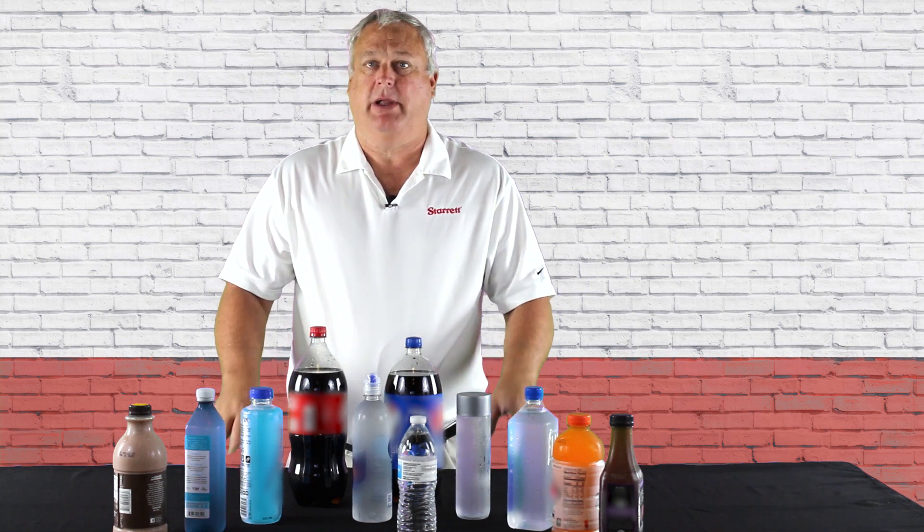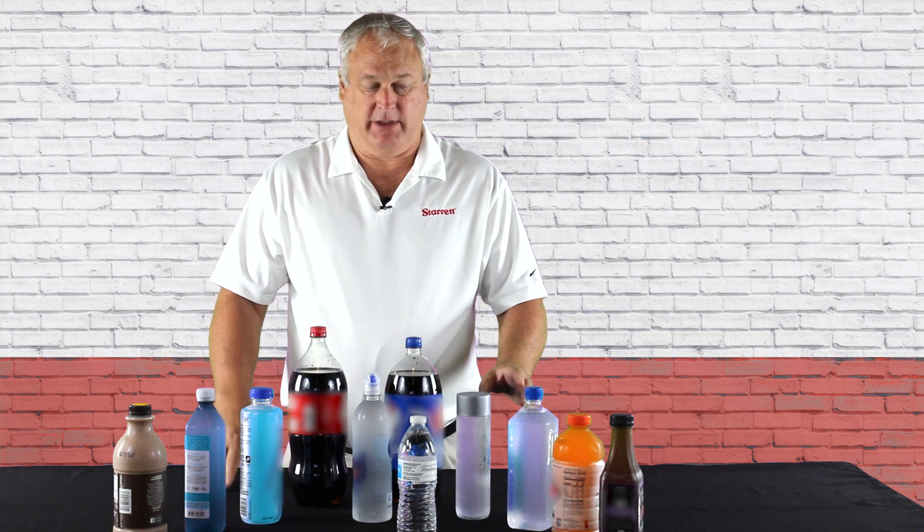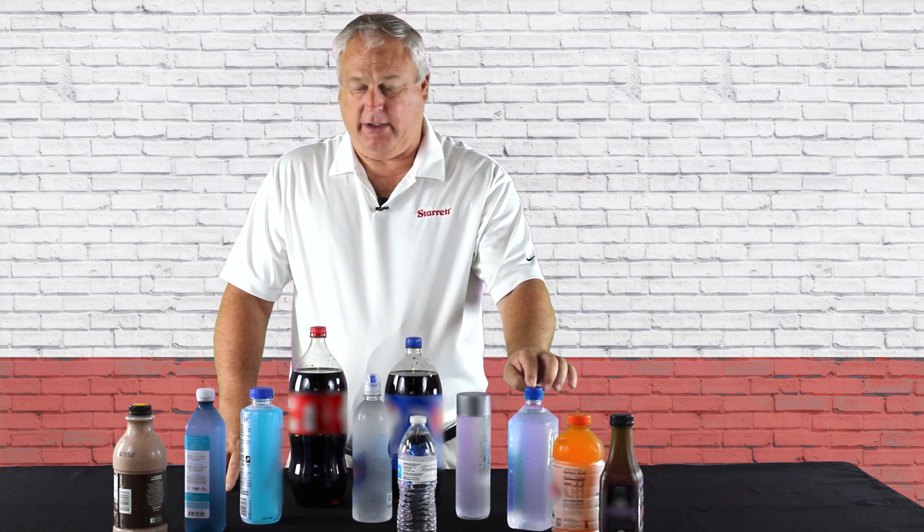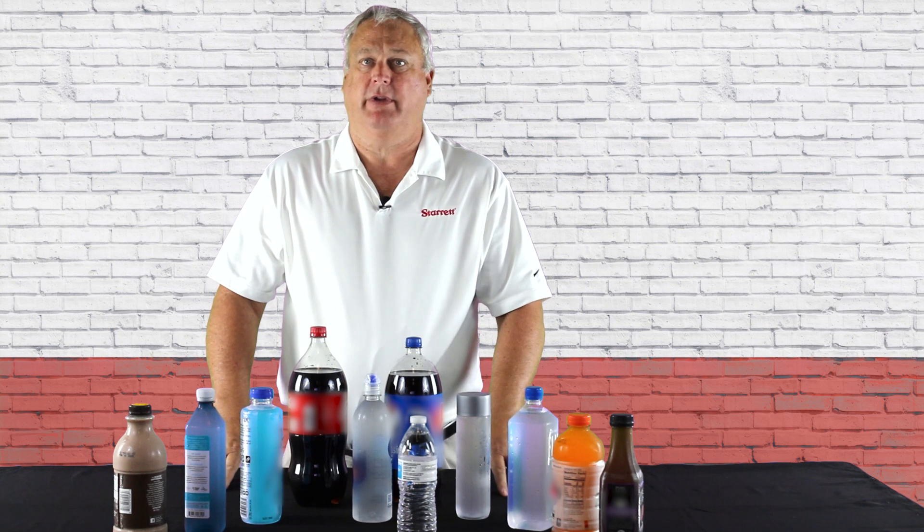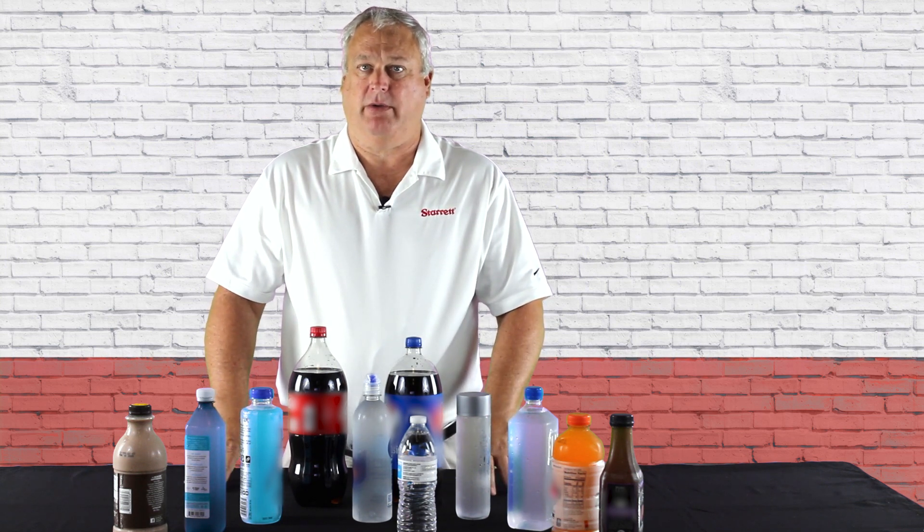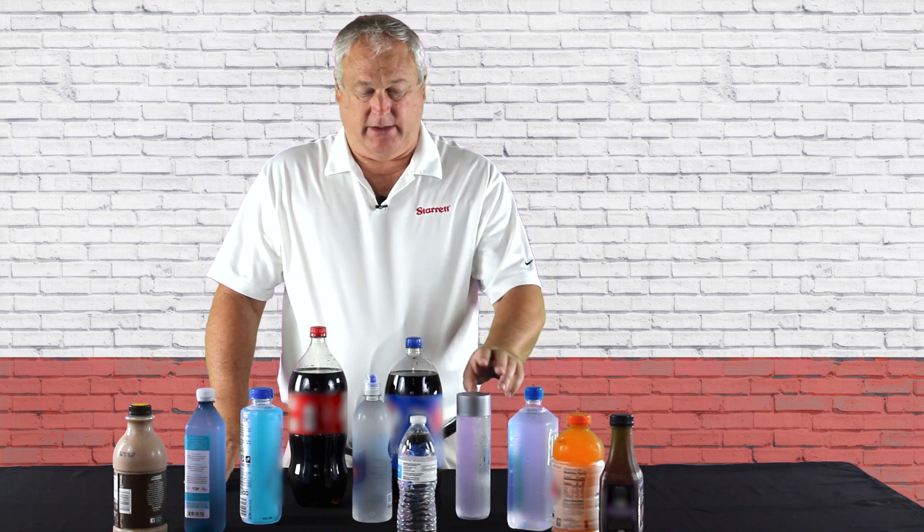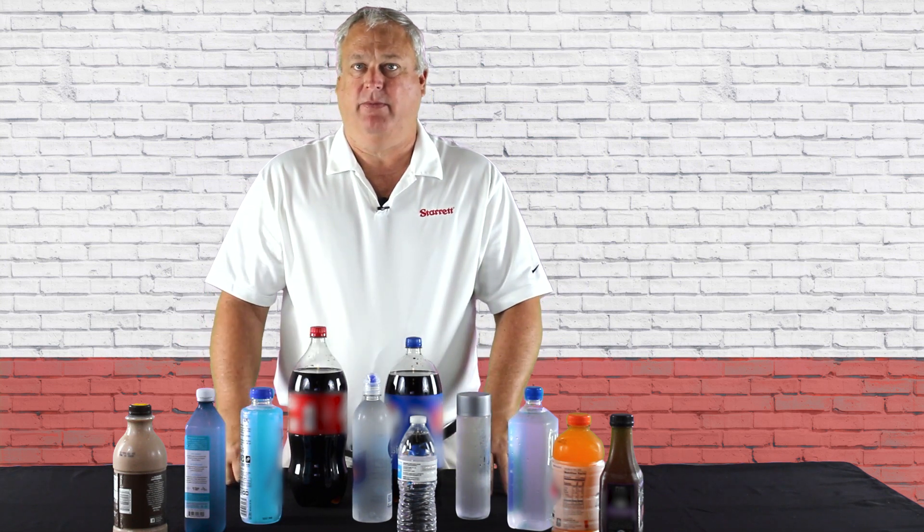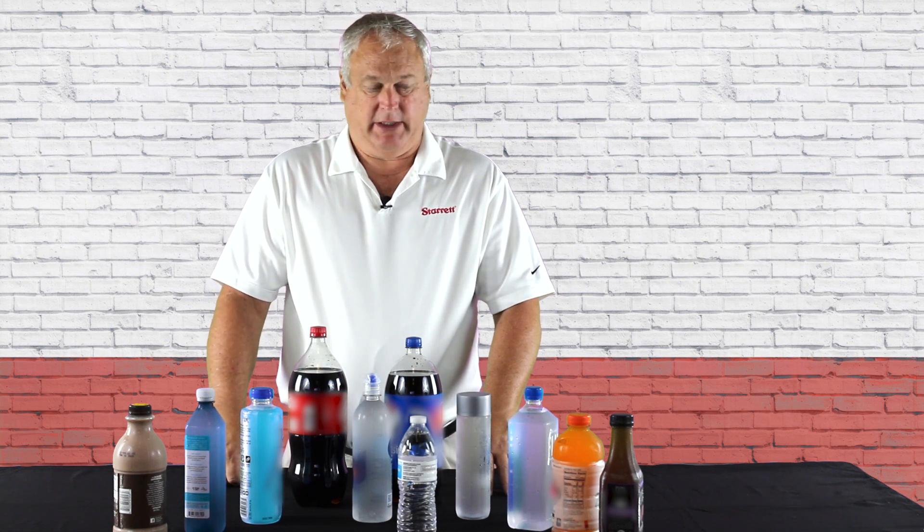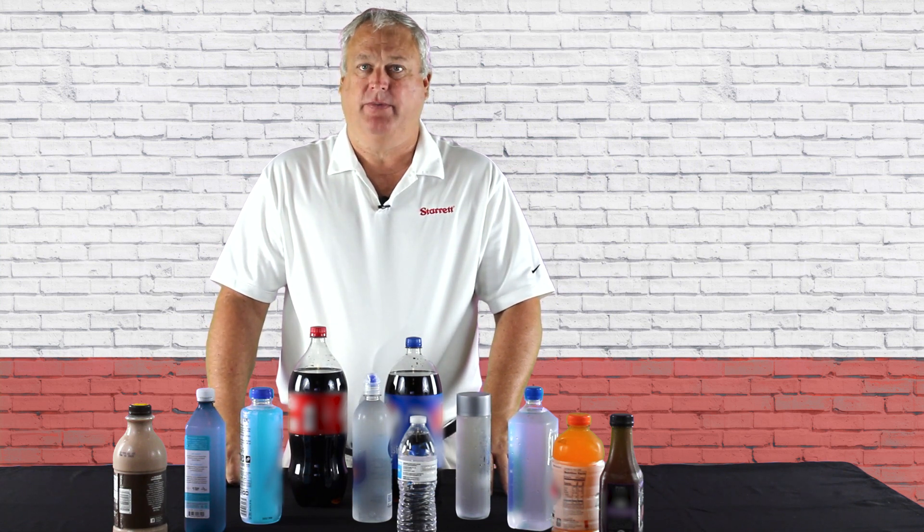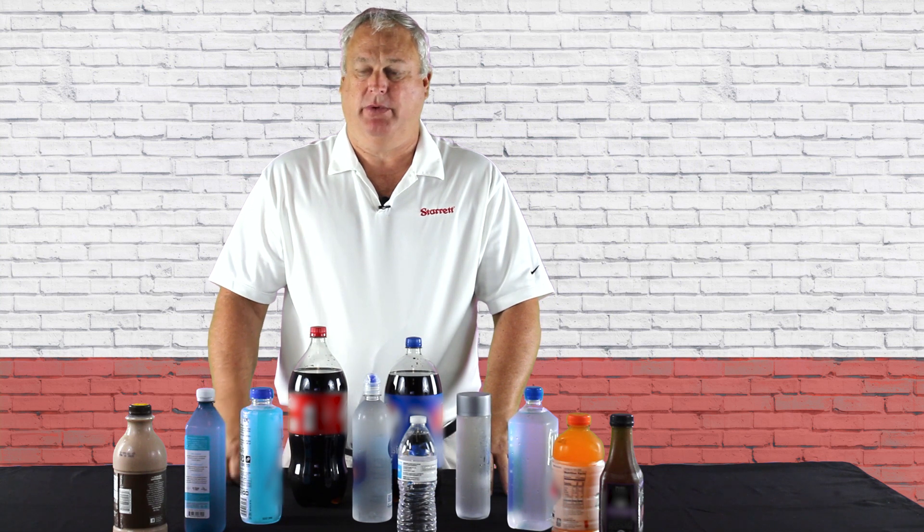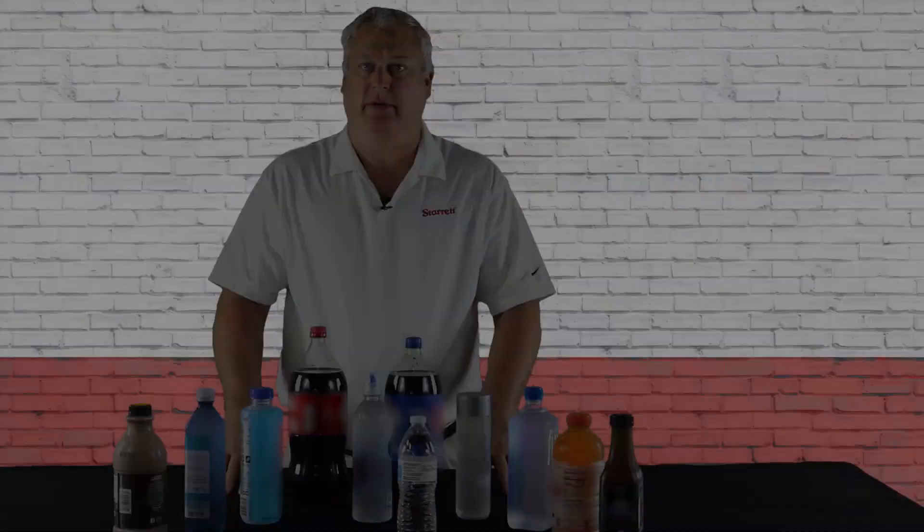Each bottle has its own design and characteristics when testing. These square designs were made for shipping. They pack more into a container, so you can fit more bottles when shipping across the ocean. Round bottles are made for easy handholds and each one will test differently. We're not going to test them all but we will test a variety of the different bottles in the next series.